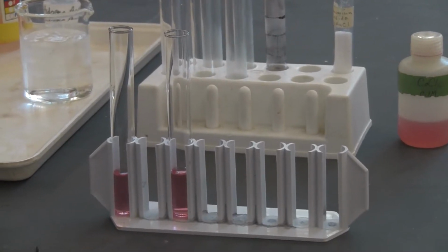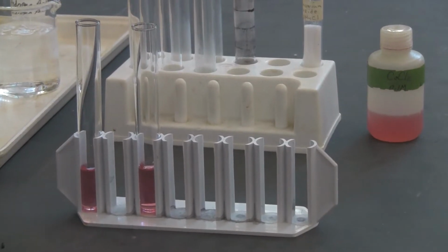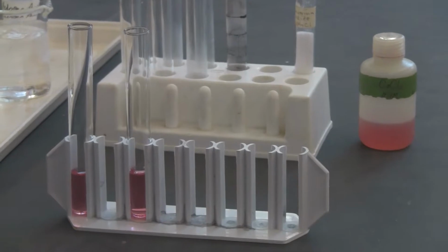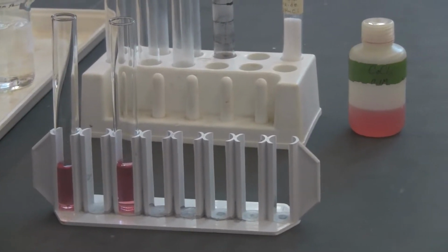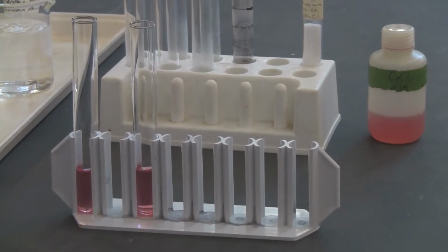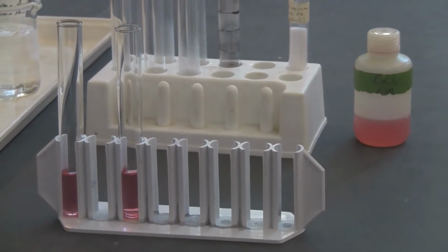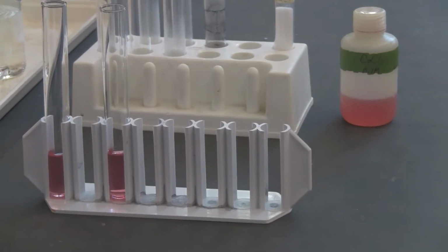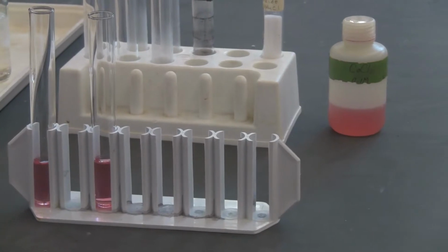Okay, for the equilibrium part H, we're going to test the cobalt chloride equilibrium. So you have the equilibrium. Then we're going to set up the equilibrium. Here you can see in the two test tubes, they both have about 2 milliliters of the cobalt-2 chloride solution in there. You can notice the color of it.